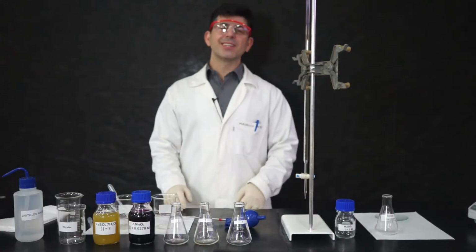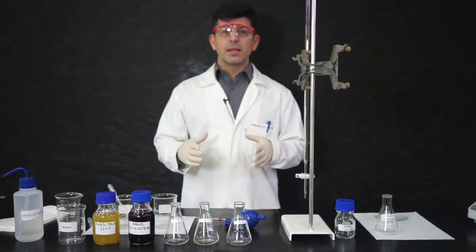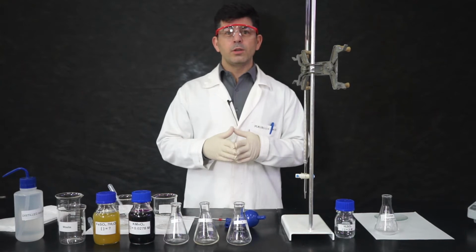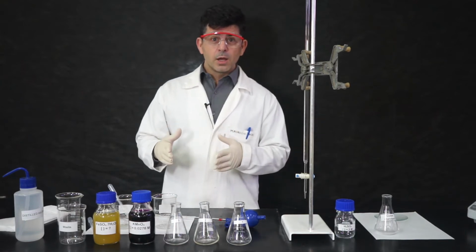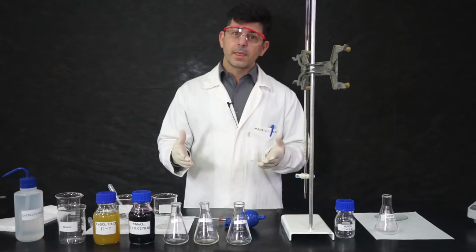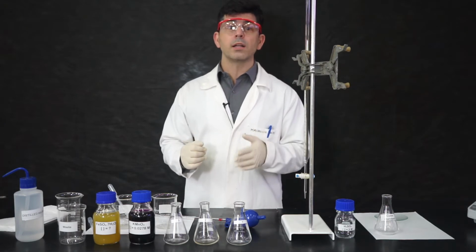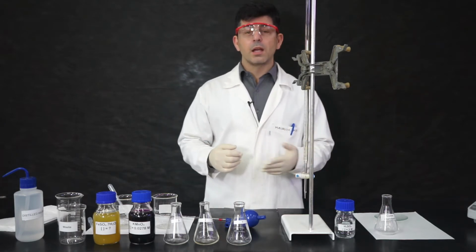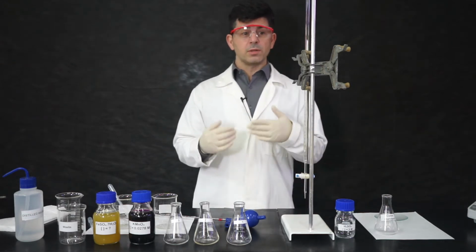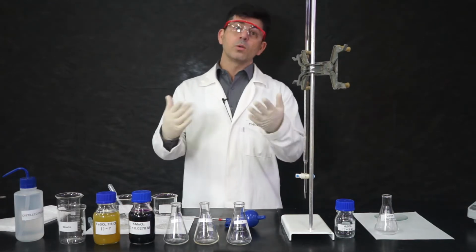Hello, IB Chemistry students. Today we are in the lab to do an analysis of a rock that is rich in iron. So your job today is to conduct an analysis where you will discover the percentage of iron in this rock. So we're going to use the strategy called redox titration. The iron can be oxidized by potassium permanganate, and then we will be able, through this titration, to determine its percentage.